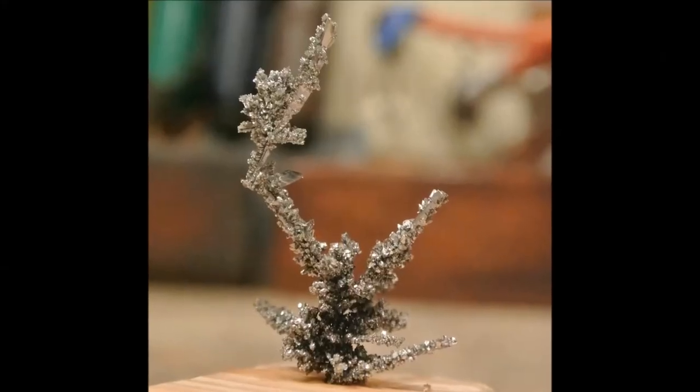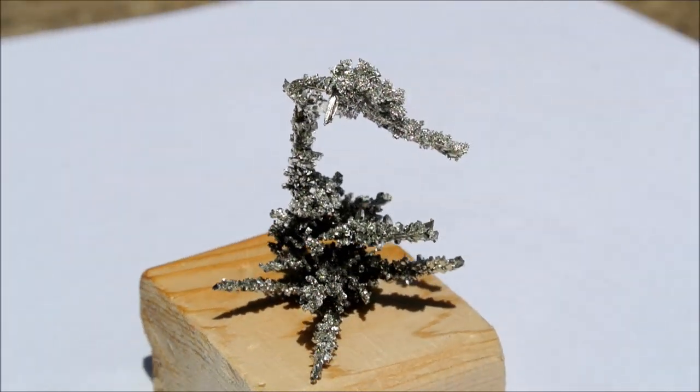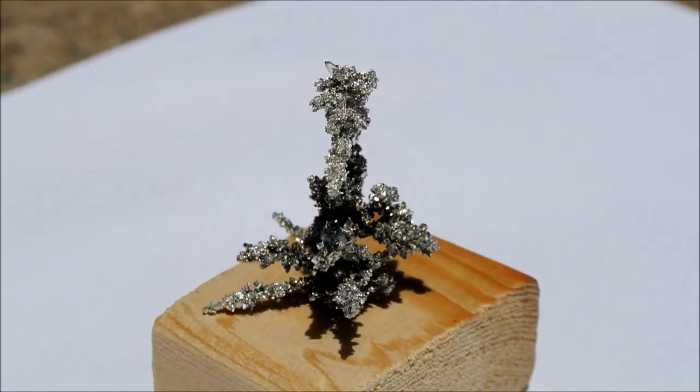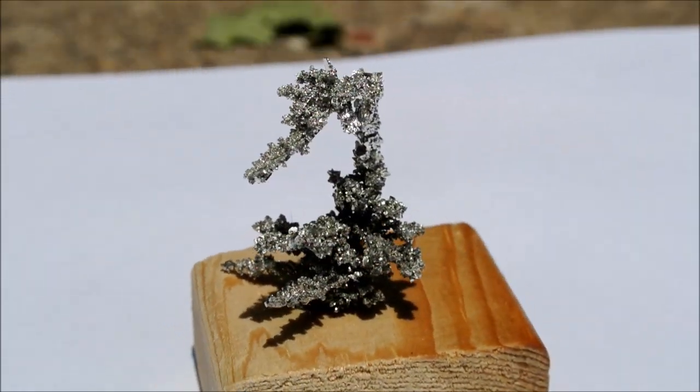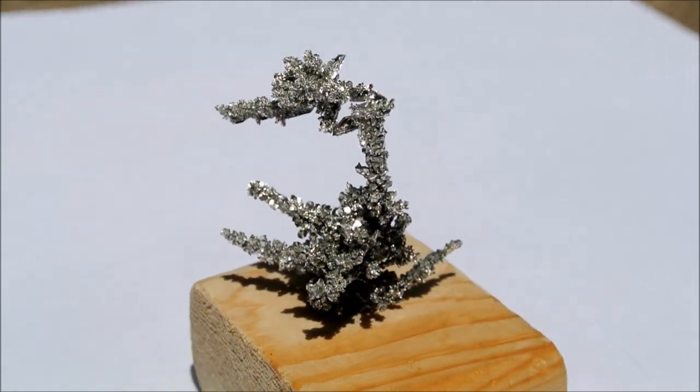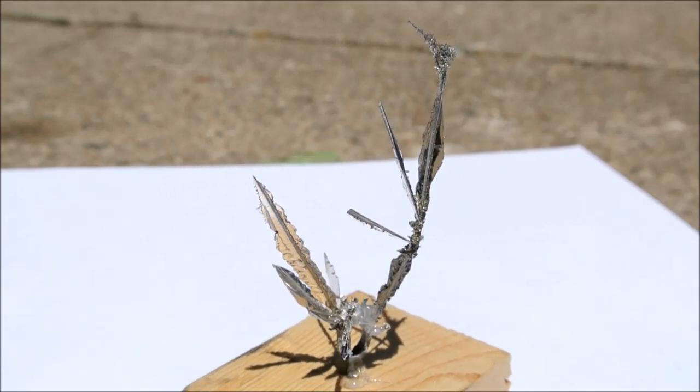This crystal turned out quite well with a variety of large and small crystal faces. I made some 360 degree video using a microwave turntable motor, but I still wanted better crystals. I reduced the concentration of the electrolyte by about 30% and tried again. The new crystal grew practically overnight, yet it turned out over 6 centimeters high.